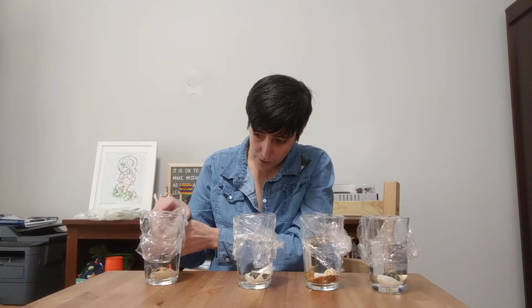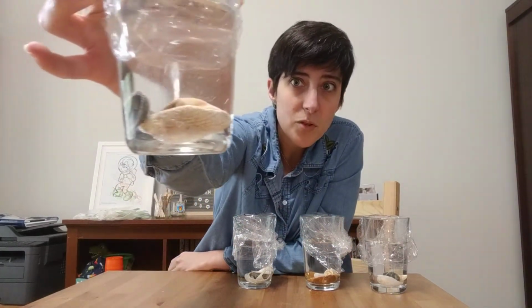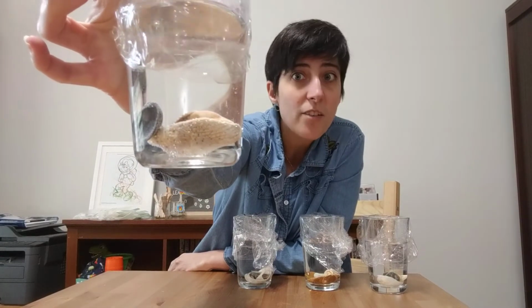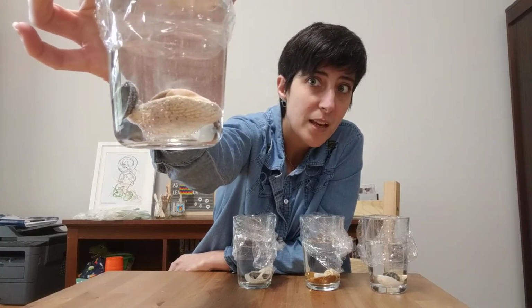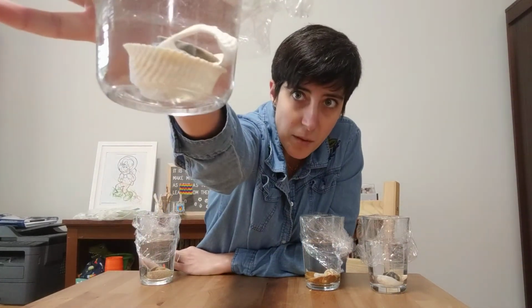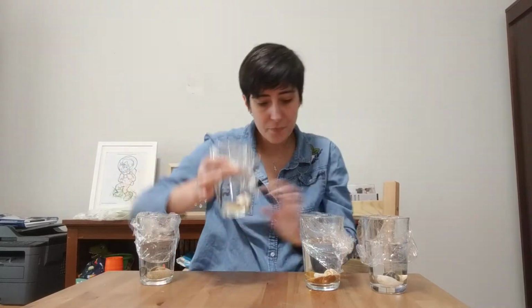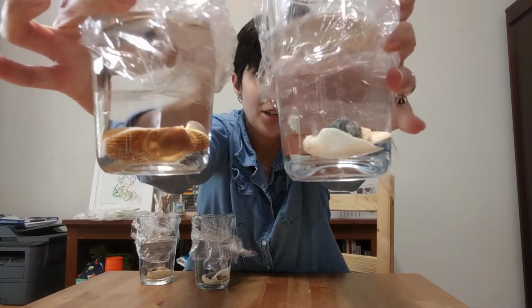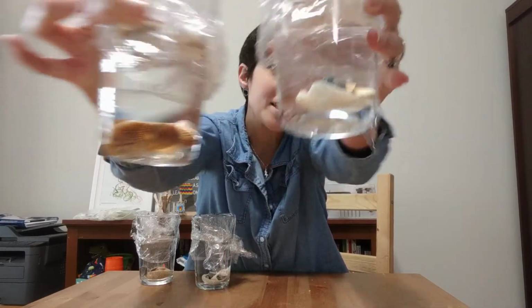Now, even just initially, the reason I wanted to do a 50% one is because you can start to see stuff happening right away. So in this one, you can see that there's little bubbles rising to the surface. That's the shells breaking down. So they're already starting to dissolve in there. Now, of course, the other ones, here's 10%. You can see some bubbles coming off, but not too many. And then the 1% and the pure water just look like shells in water. You can't really see anything happening.